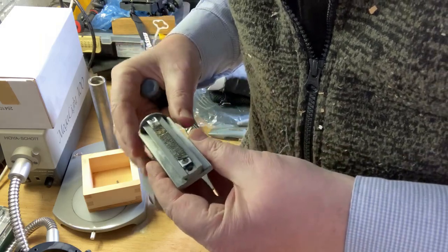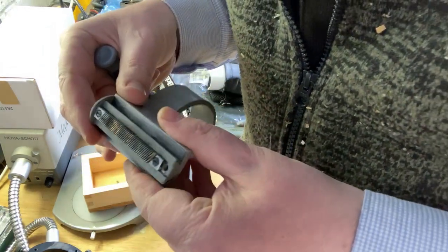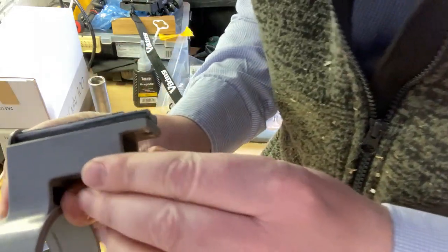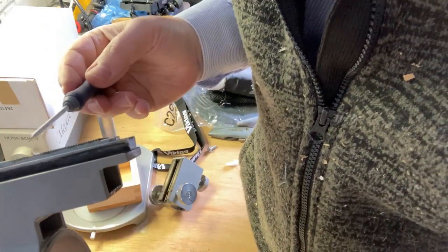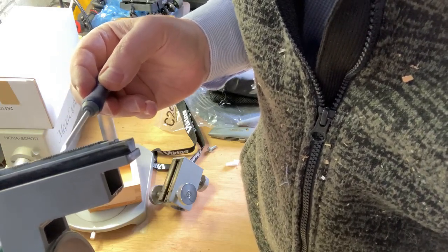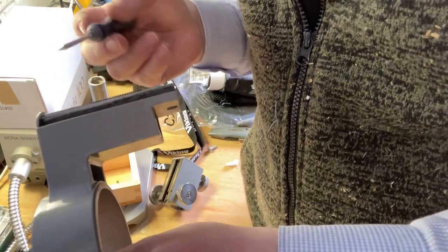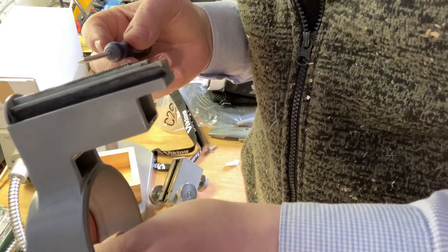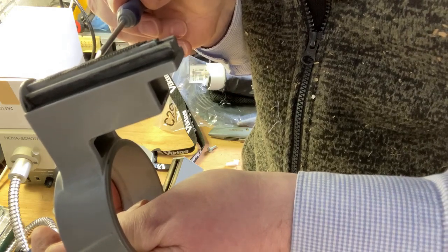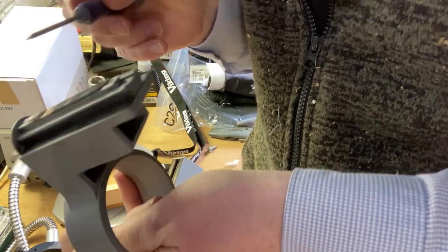Right, so this is the bar that is running it down, and I'm not sure if you will be able to see that at the side, but basically it's been ground at this bit, and there's a small bit here as well, which is, I think, sometimes not catching. I don't know if that will show up, maybe there. Right, okay, so this is ground here, and there's a small bit here as well. You can see it's also done at the end as well.